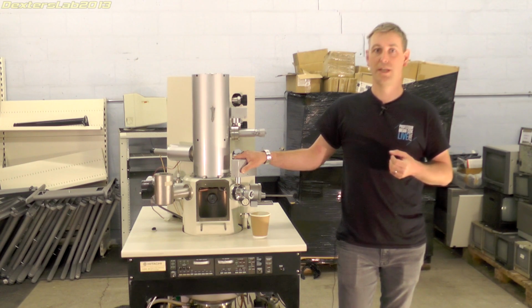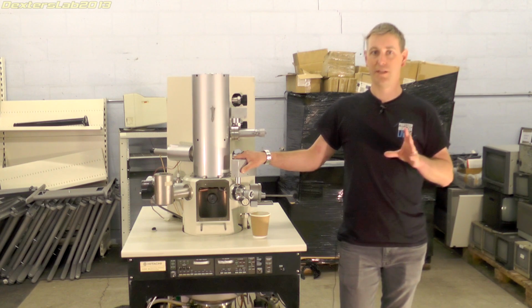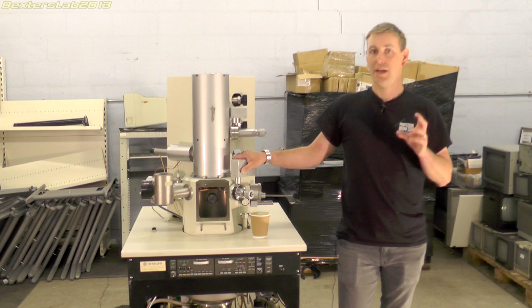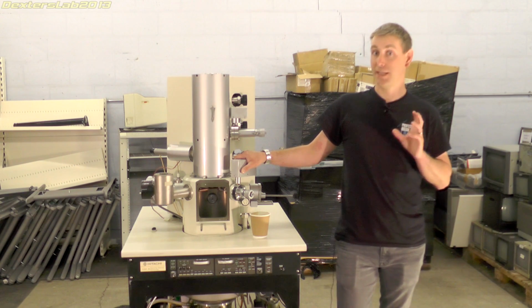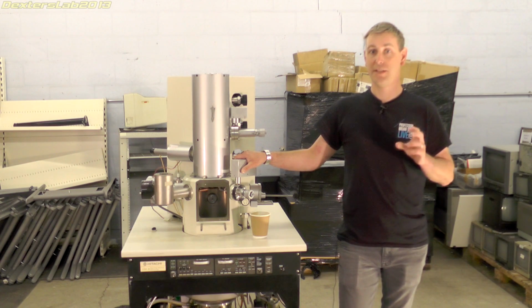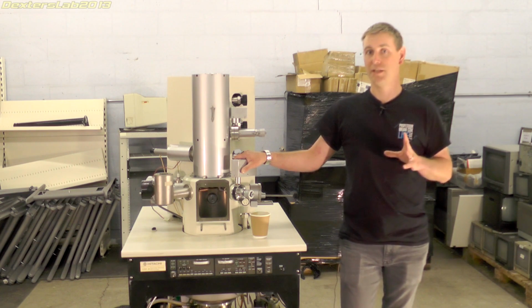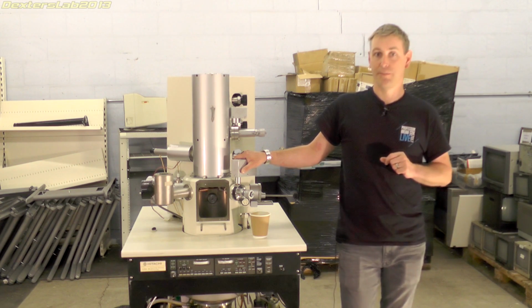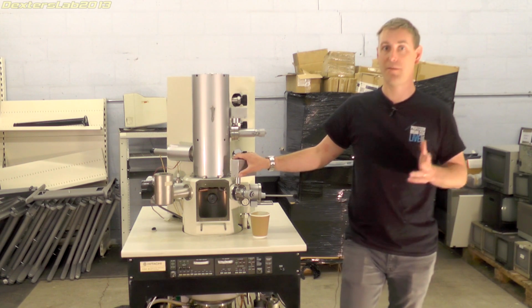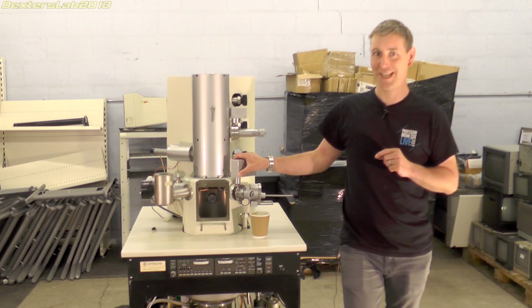If you arrange it so you can scan the beam of electrons over the subject, when this beam hits the subject, it promotes it to release additional electrons. These can be collected by a detector and turned into an electrical signal, which can then be displayed on a CRT in sync with the beam. Or alternatively, you can digitize them and do the whole thing digitally. And of course, to do all of this, the electron gun and the sample have to be under high vacuum because you can't push electrons through air.